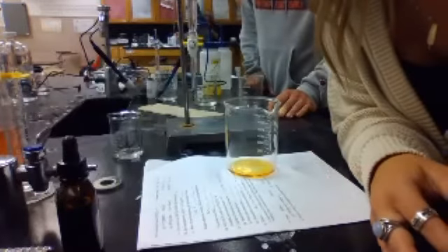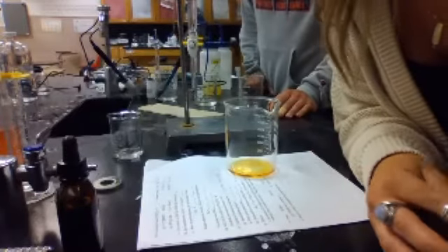We're supposed to find how many milliliters are needed. Did they do that yet? Did you do that? That was what we were supposed to fill in for 6. For 6, you're supposed to find the milliliters of the base that I need to stop at.